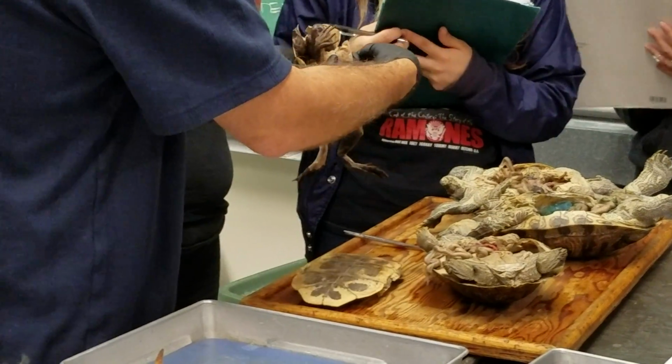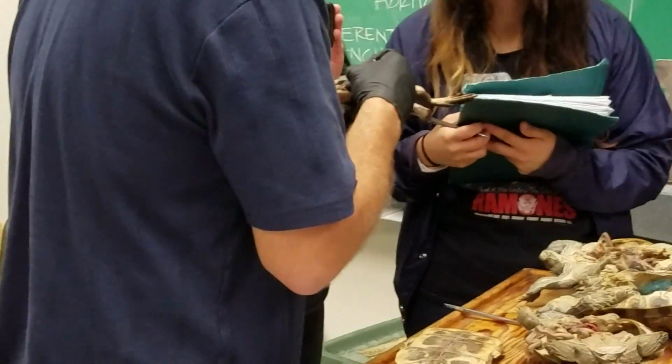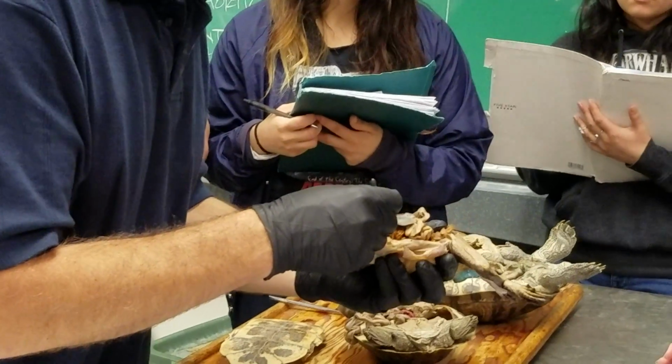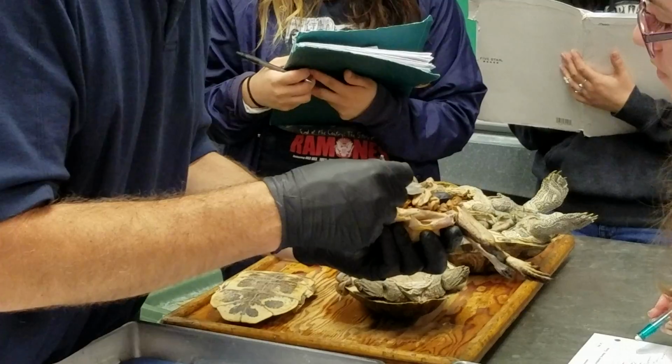So it's called pulmocutaneous. John, did you show us the external carotid? I did. I can. So this is the carotid arch. This is the external carotid. This is the internal carotid. Oh, okay.